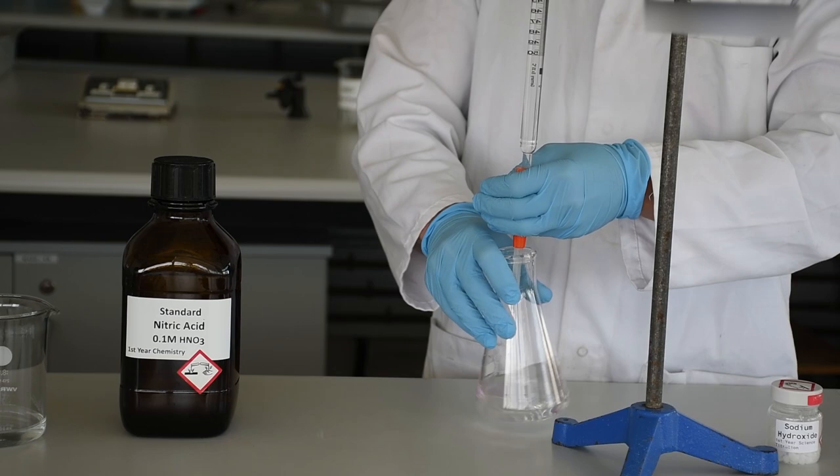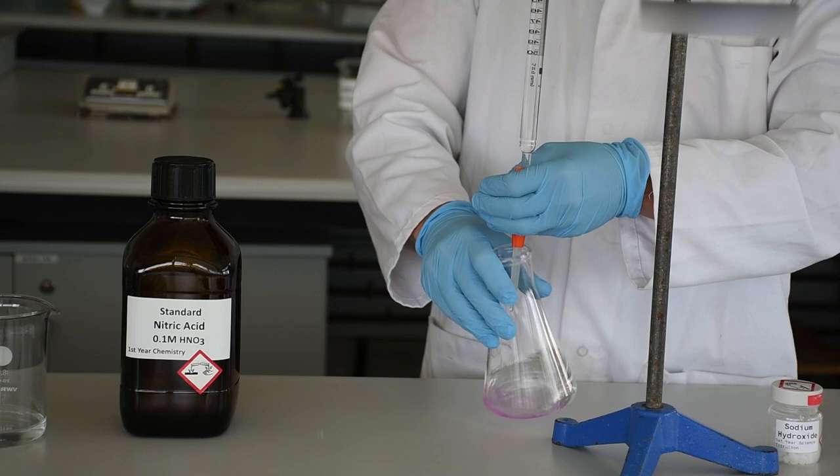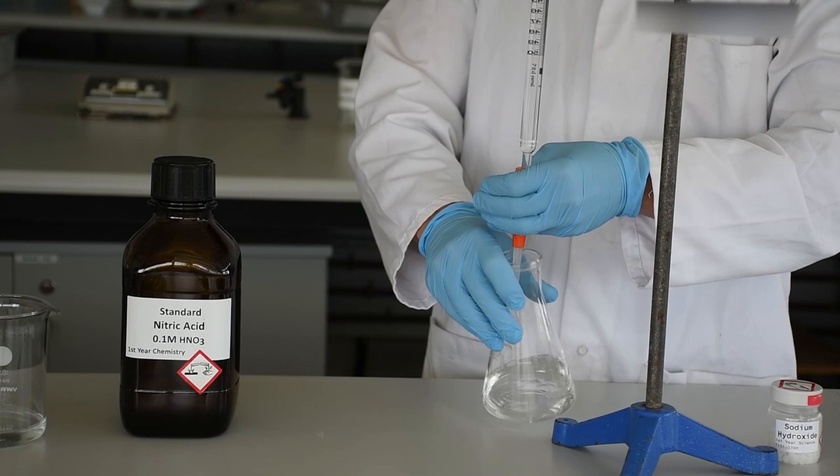If you do it right, it is possible to get it to within one drop. One drop is going to change your solution from being perfectly colorless to a solid pink color. This time we're just doing our rough titration, so we get to the pink color at the end and then we stop.